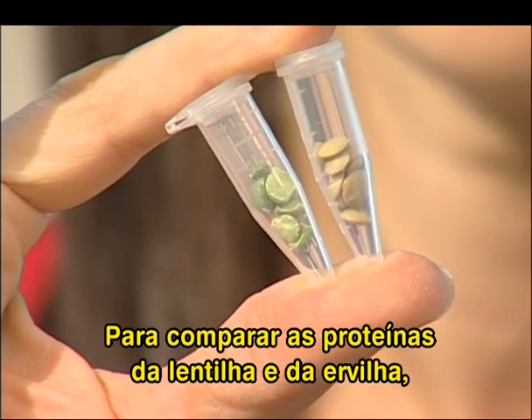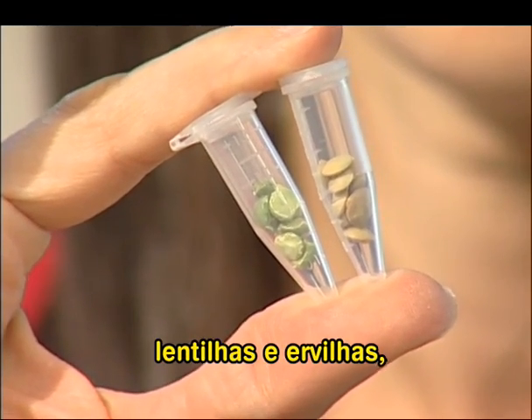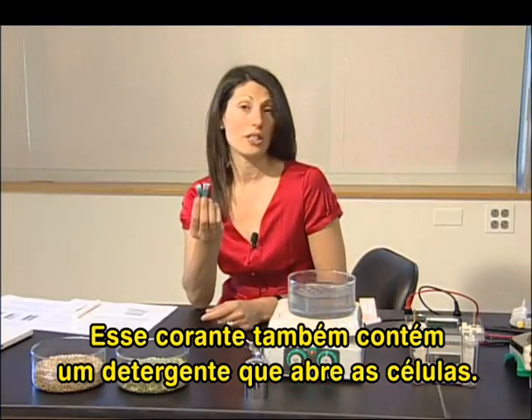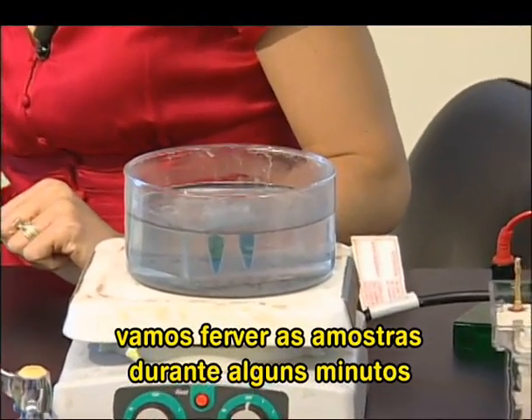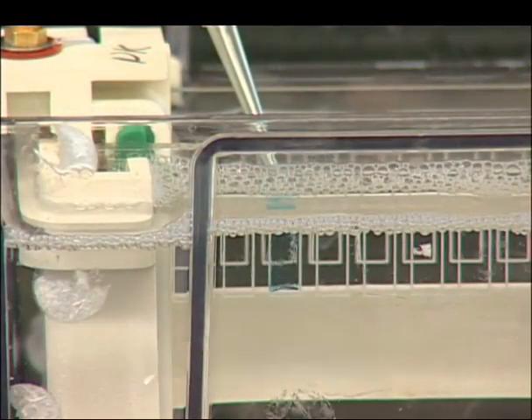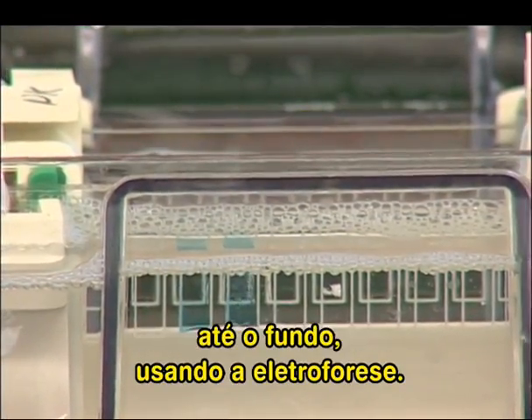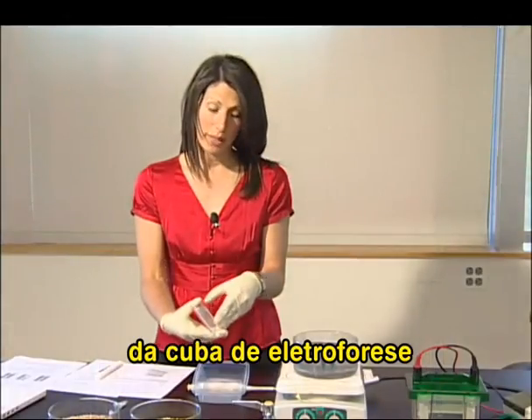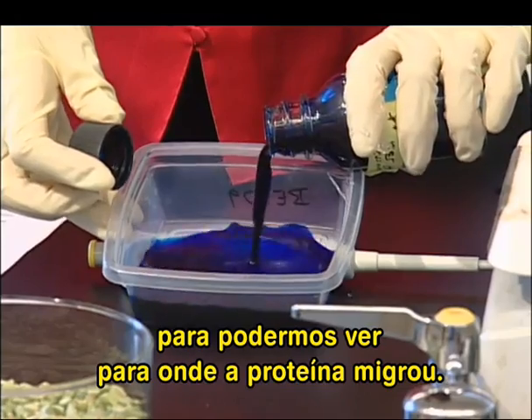So if we wanted to compare the proteins in lentils and green peas, we'd start by collecting some cells — some lentils and some green peas — and to these cells we would add some dye. This dye also has some detergent that helps break the cells open. To further break the cells open, we would boil the samples for a few minutes, and then move on to the next stage, where we load the sample onto a protein gel. The protein gel separates proteins by size, with the smallest proteins moving fastest through the gel to the bottom using electrophoresis. In the last step, we remove the gel from the electrophoresis chamber and mix it with a dye, Coomassie Stain, that lets us see where the proteins have moved through the gel.